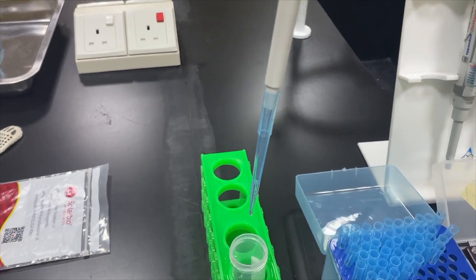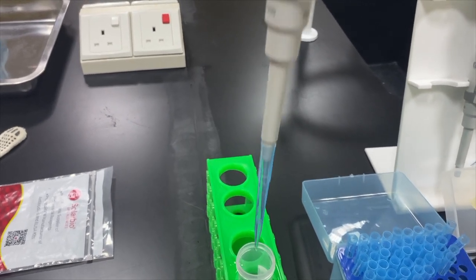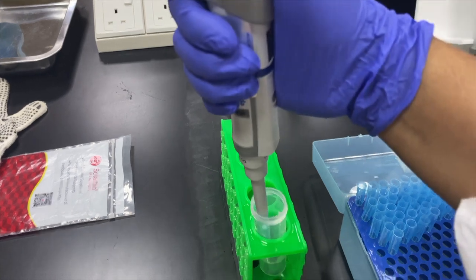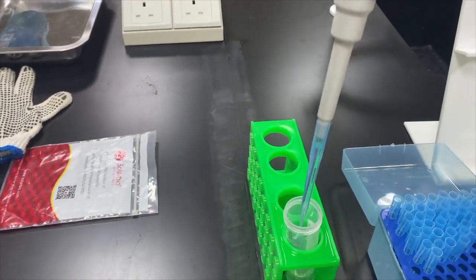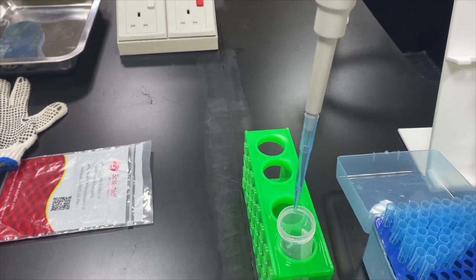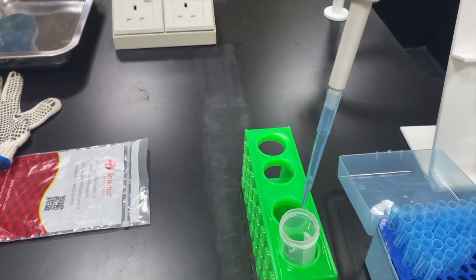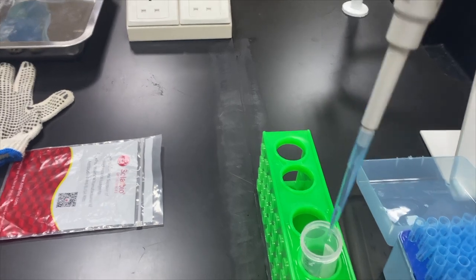Okay. So, there will still have some liquid and then you, let's say, you take another one milliliter. And then you dispense into another tube. Just like that. And then just remember, the rest, you should discard to other place.